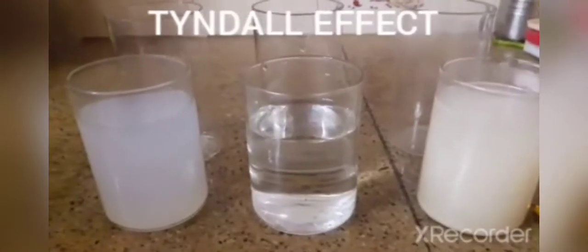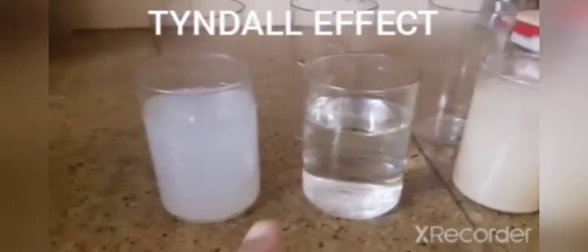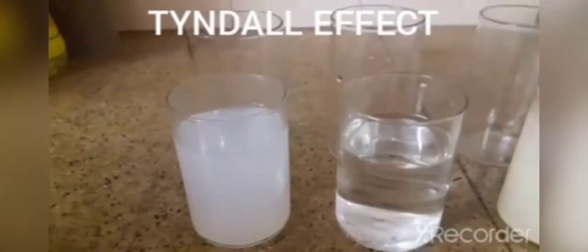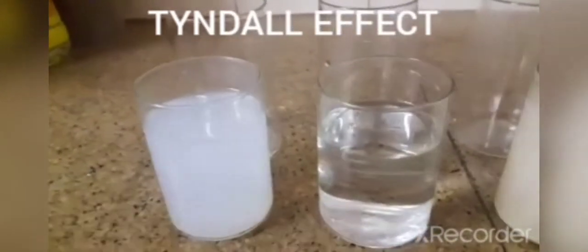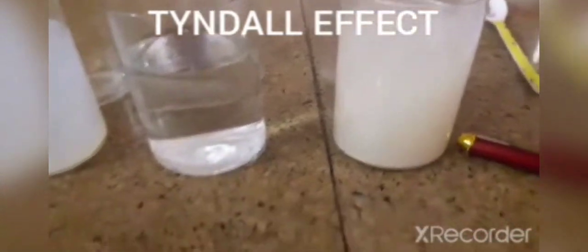Hi everyone, this is Ludhiana and today we'll be experimenting on three different kinds of mixtures. The first one is a colloidal solution of diluted milk. The second is a true solution of sugar in water. The third one is flour in water, which is a suspension. And here I have an observation table in which I'll mark my observations.